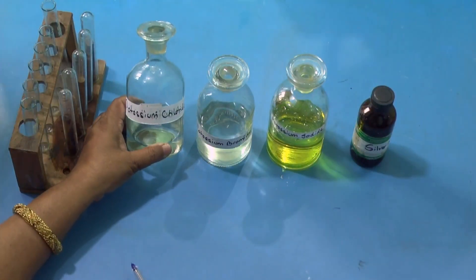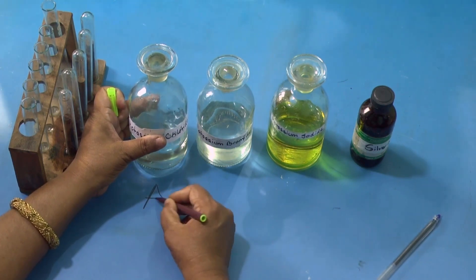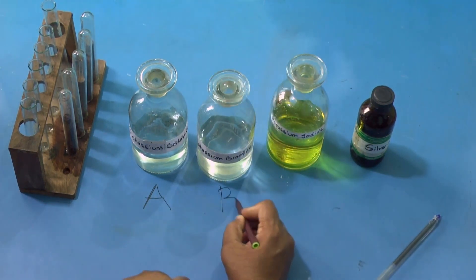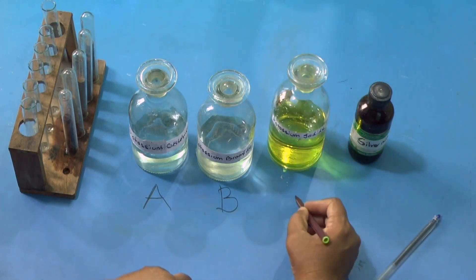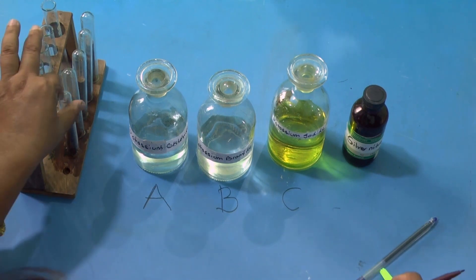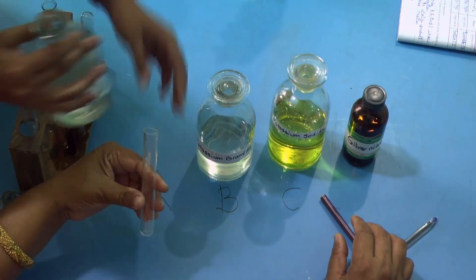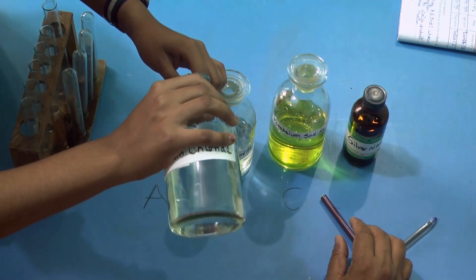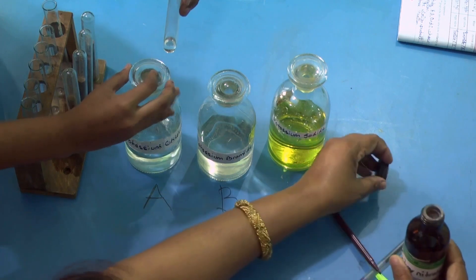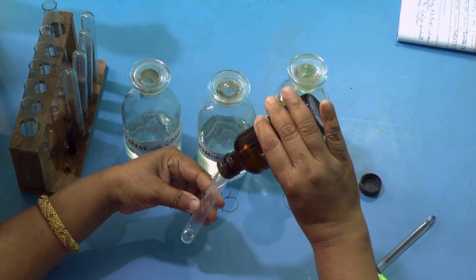Children, potassium chloride solution is labeled as A, potassium bromide solution is labeled as B, and potassium iodide solution is labeled as C. We also have silver nitrate solution. It is mentioned to take 5 ml, but we will be taking a little lesser — it is not needed to take so much. Now I will be taking the solutions into test tubes and adding silver nitrate to get the test results.